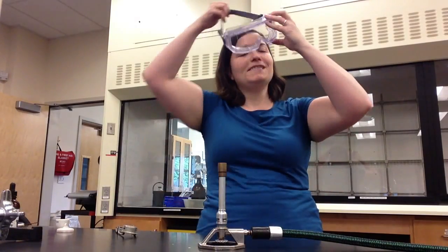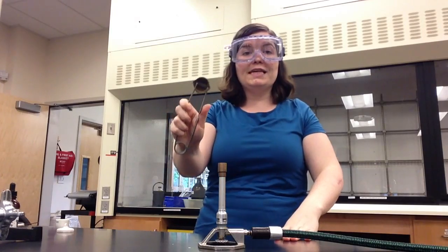Before I light my Bunsen burner, I'm going to put on my safety goggles. You'll be lighting a Bunsen burner using a striker. If you pull hard on the striker, sparks are produced, which will allow you to light the Bunsen burner flame.